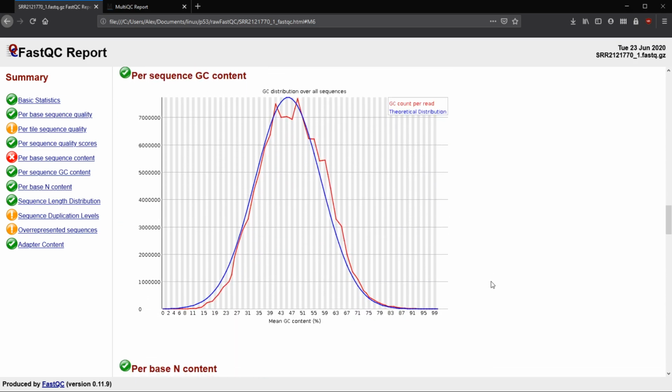Next, we have our per sequence GC content. So this is what I had mentioned before, in whole genome sequencing for DNA, we would expect this distribution to have a peak at whatever our genome GC content is. And the GC content of the mouse genome is about 41%, depending on where you look, just from quick Googles. And we can see at the very beginning with the basic statistics that our average GC content, this peak, is at 47.